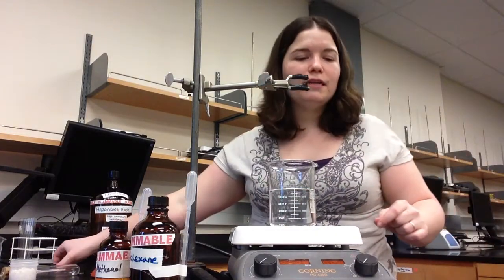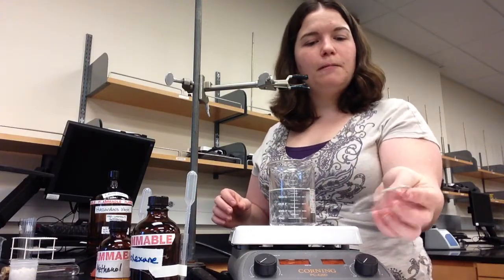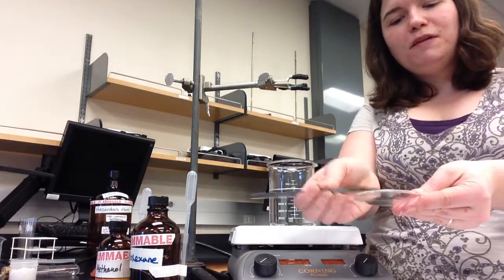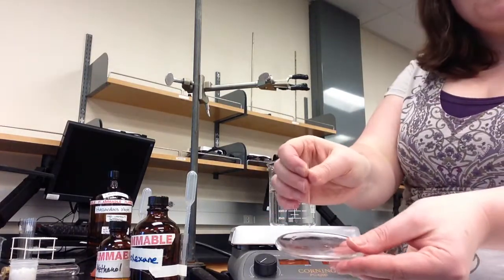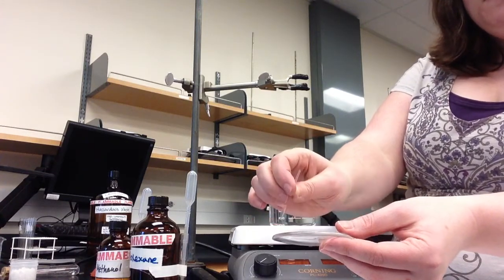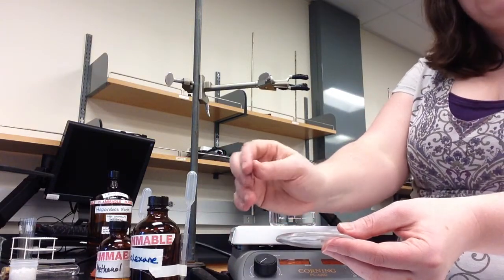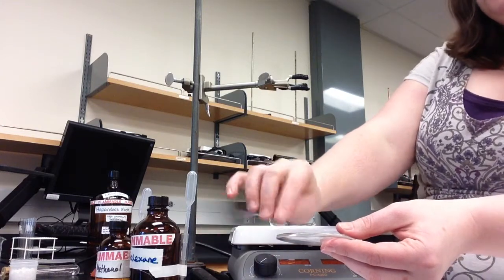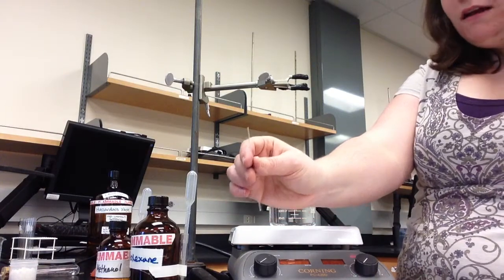Before you can put solid into the capillary tube, you first need to put a little bit of solid into a watch glass. You could then use a scoop to crush it into little pieces so that it will fit in the capillary tube. To get this unknown solid into the capillary tube, scoop a little bit of the solid up in the capillary tube and tap it down on the lab bench. Be careful, the capillary tubes are fragile. Scoop a little bit more, tap down, scoop and tap until you have 6 to 8 millimeters of solid. Not quite 1 centimeter.